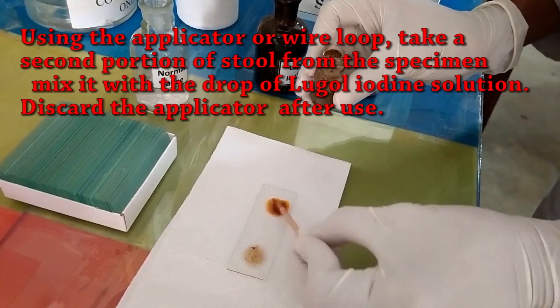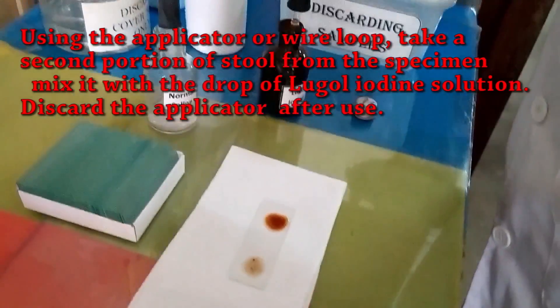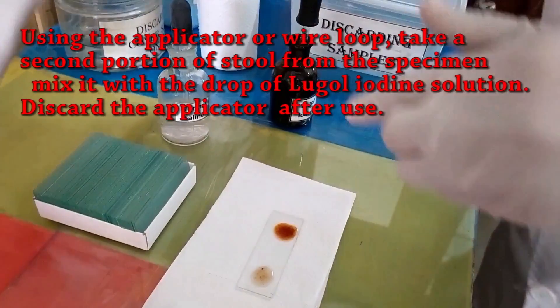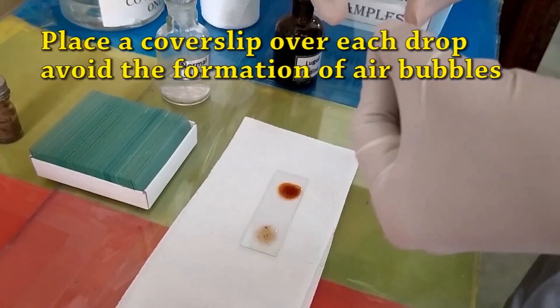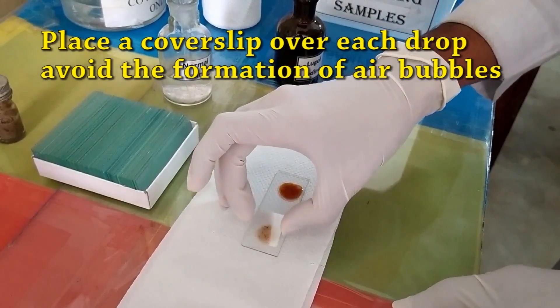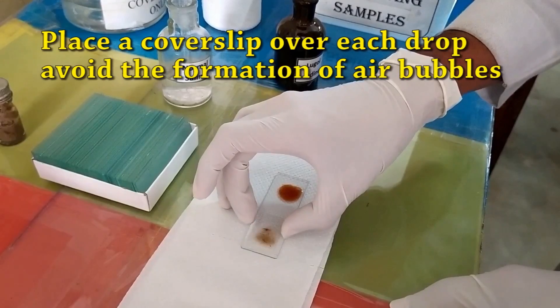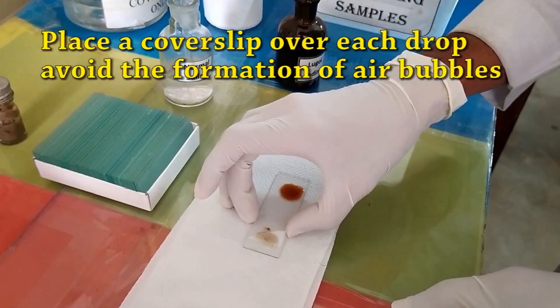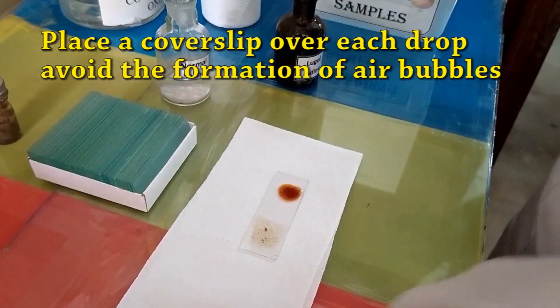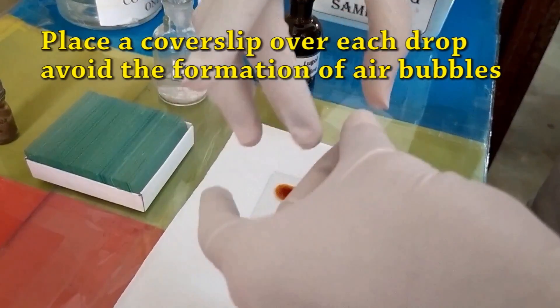Mix the specimen with the Lugol's iodine solution. Discard the applicator after use. Place a cover slip over each drop. Apply the cover slip correctly to avoid the formation of air bubbles.